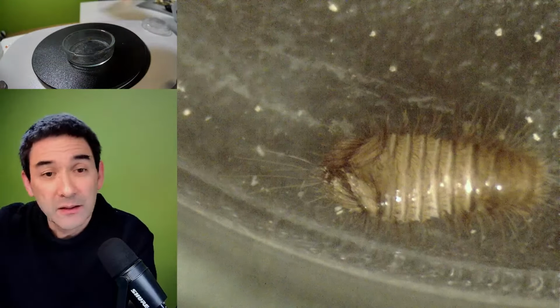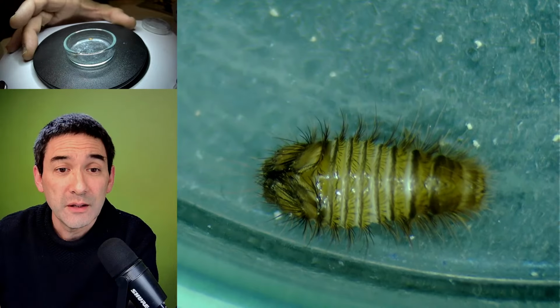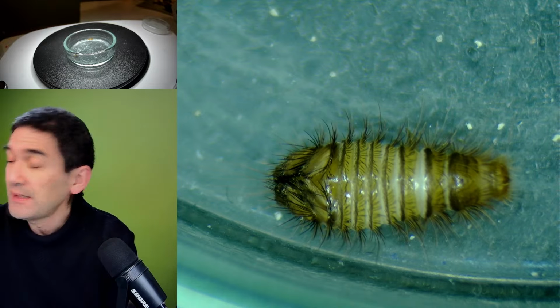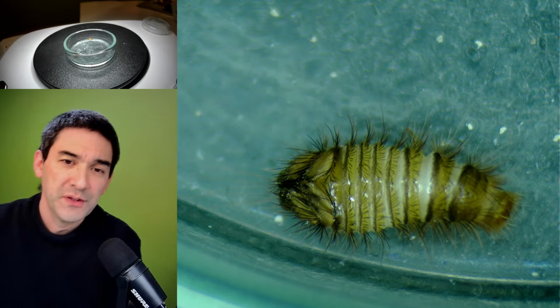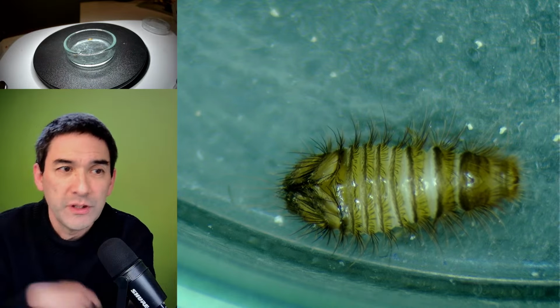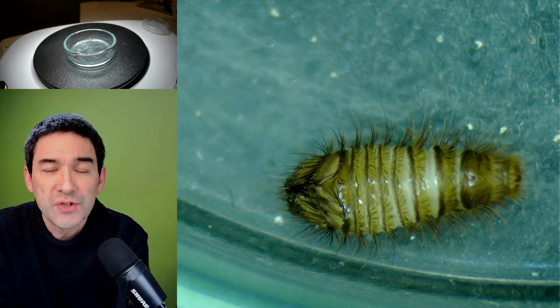I need to turn on the light a little bit here. Okay, and here it is. It seems to be sleeping, but usually when I shine light on it, it starts moving around again. This is an interesting insect. I've already made two videos about this one. I'm a little bit surprised that it was able to survive for one and a half months in my little Petri dish. You can see the Petri dish up there. And just a few days ago, I was feeding it.